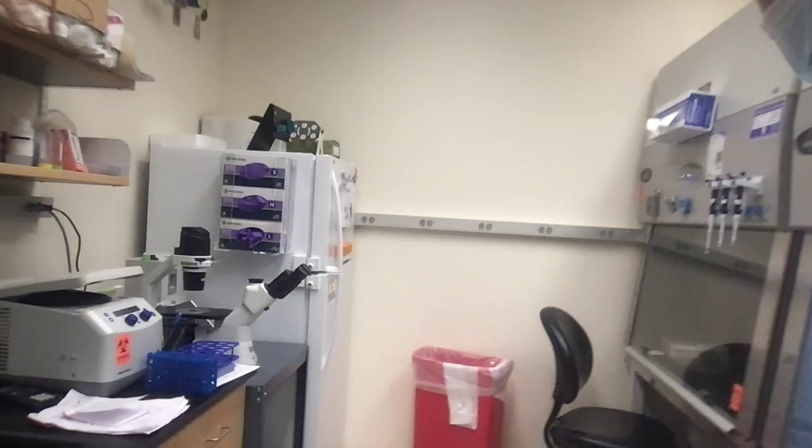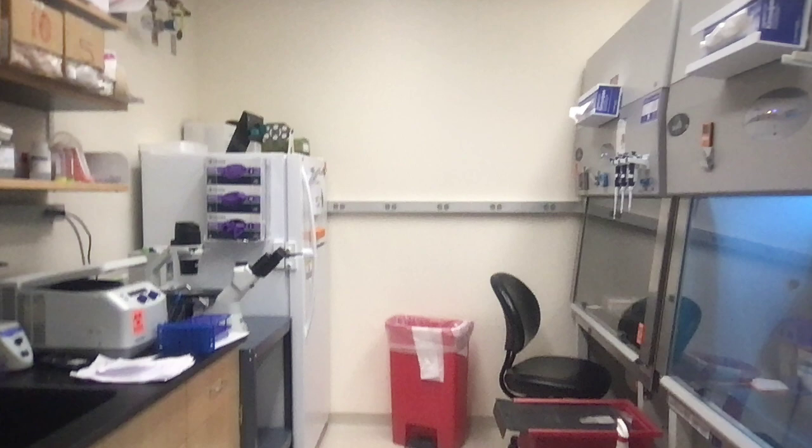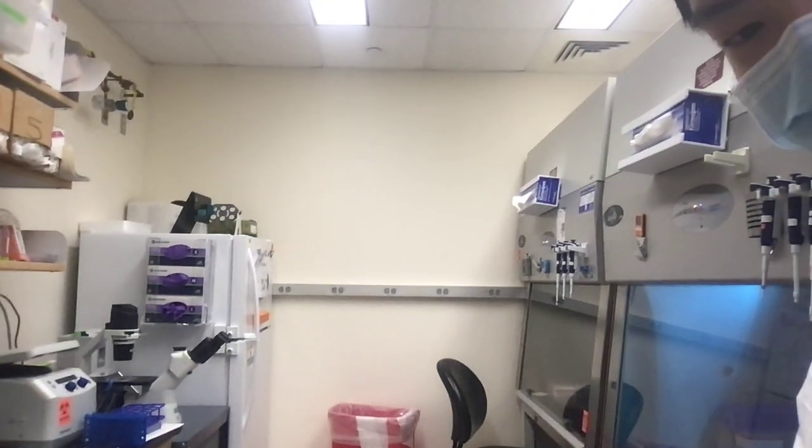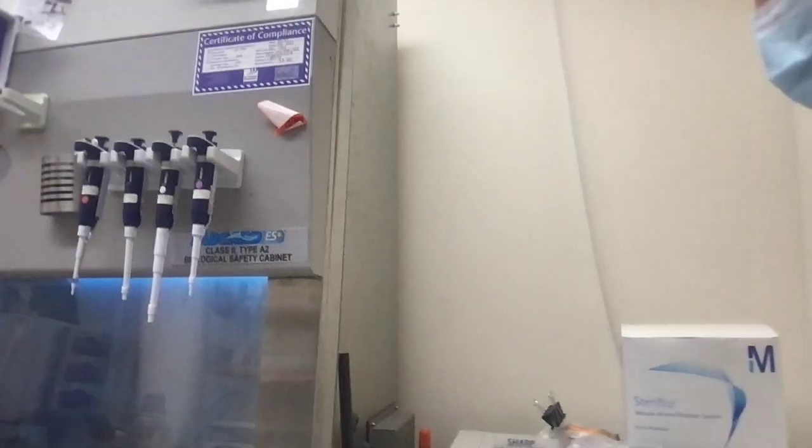And so this is a cell culture room that you can probably find in a lot of labs across the country. And since I didn't actually introduce myself, my name is Edward, and I was a former immunology master's student at Harvard, and right now I'm a research tech working in the same lab that I got my master's in.